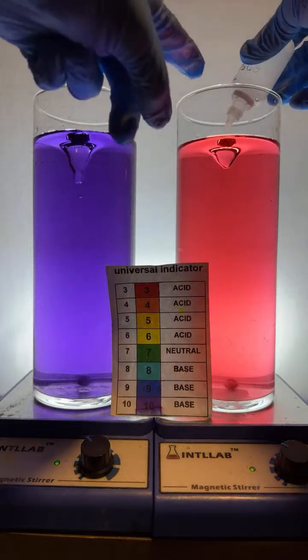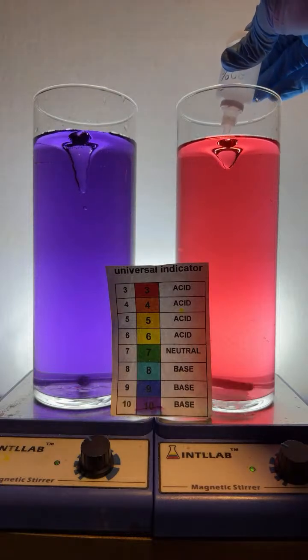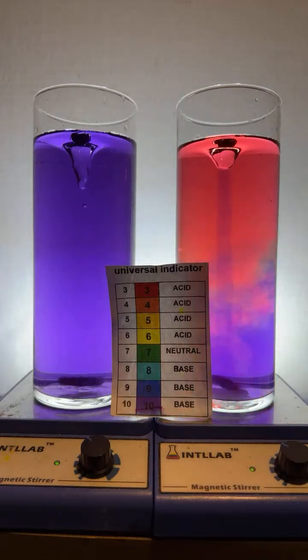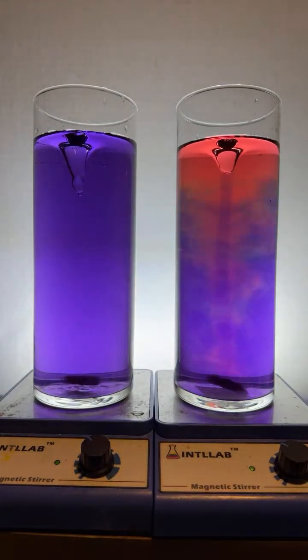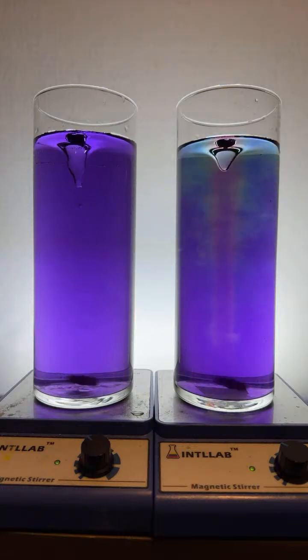Let's add another drop. I'm going to add another drop of base over here. You can see me adding right up here at the top. Add another drop of base. And let's see if the acid that's present is enough to neutralize it. I think the base is going to overpower it. You can see that violet color growing in. Sure enough, we have two very violet systems, very high pH.